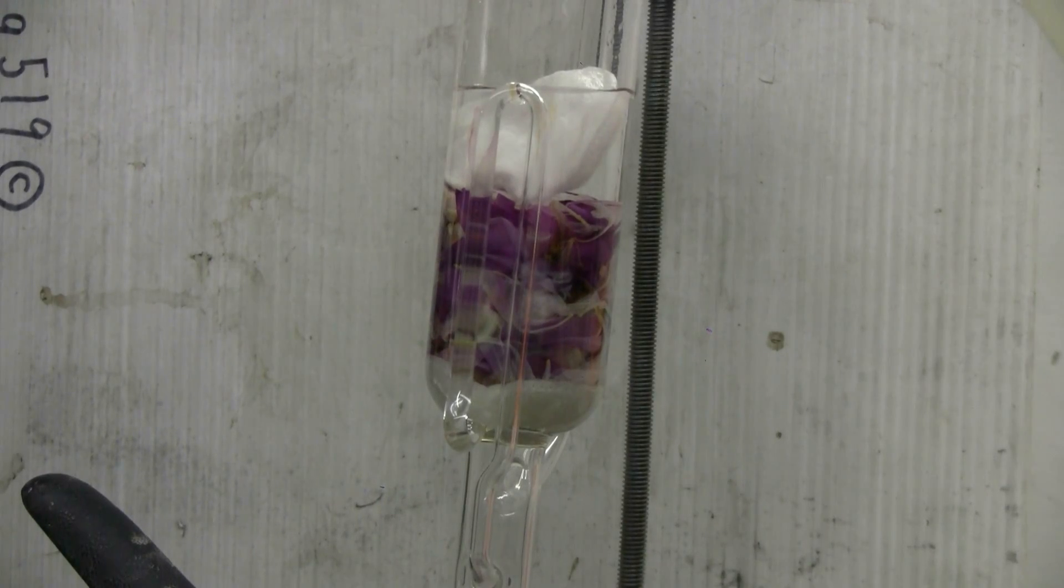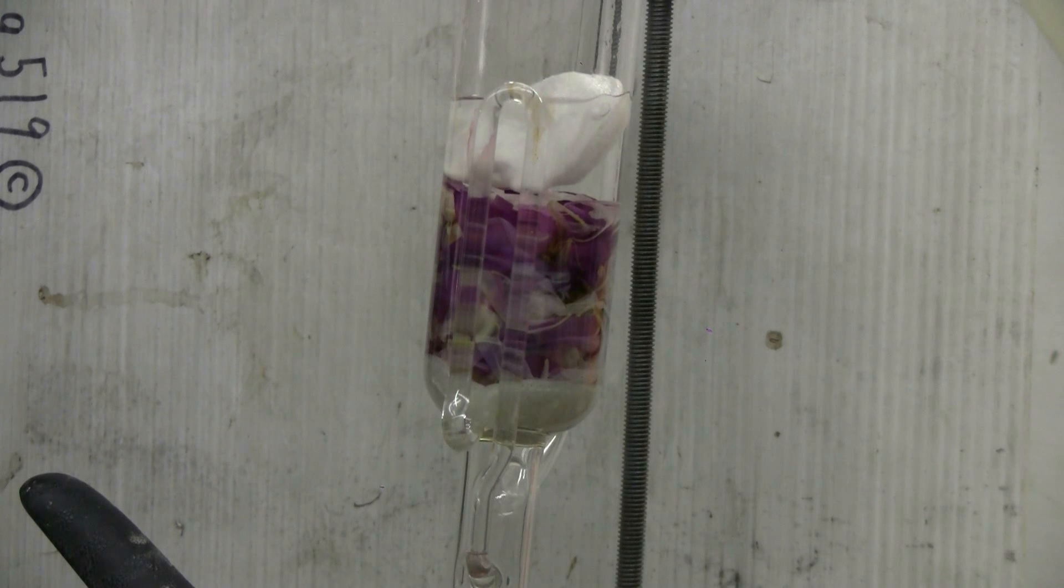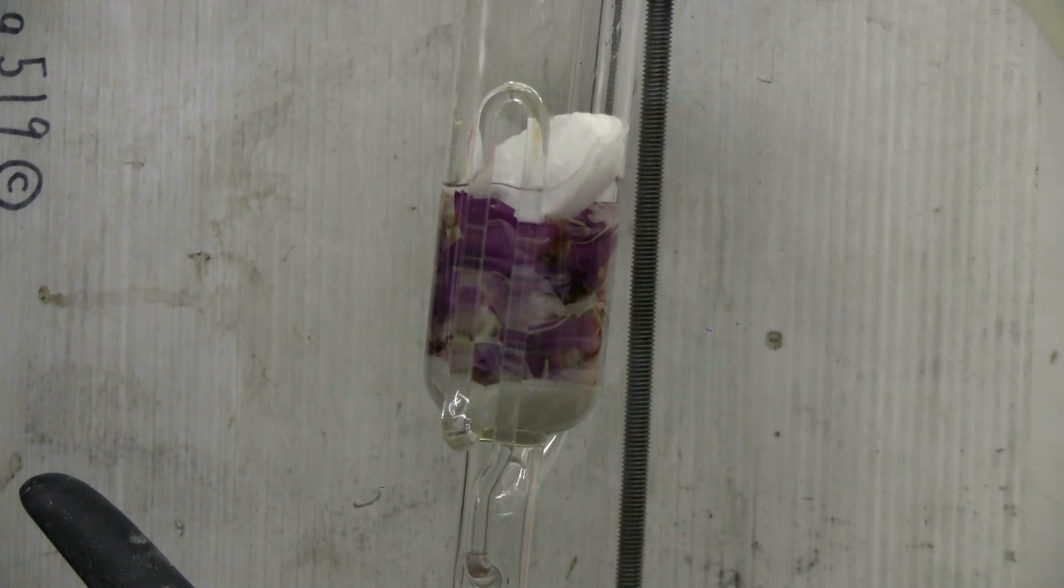This will be my last cycle, number ten, for this experimental Soxhlet extraction of peony flowers, which proceeded colorless all the way through. For number ten, I turned off all of the heat and just the residual heat in the water bath, as things slowly cooled down, drove number ten.